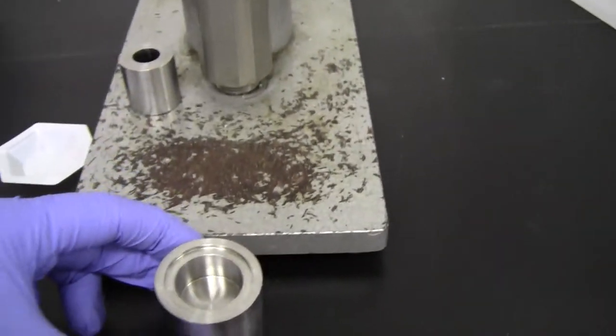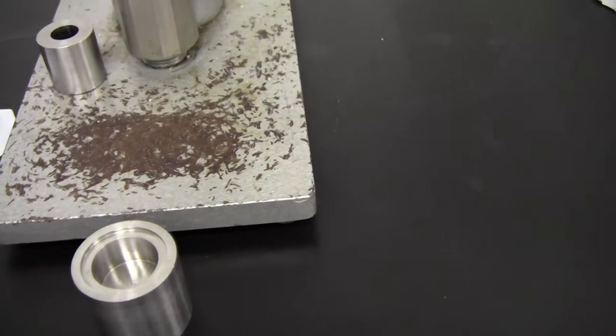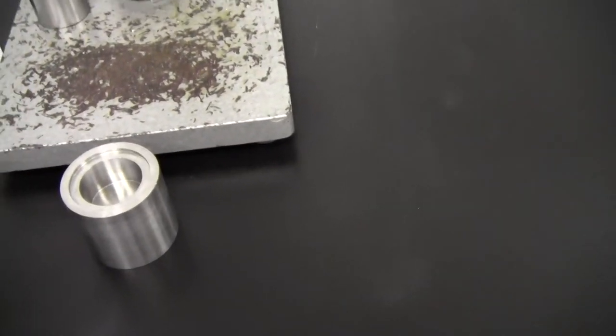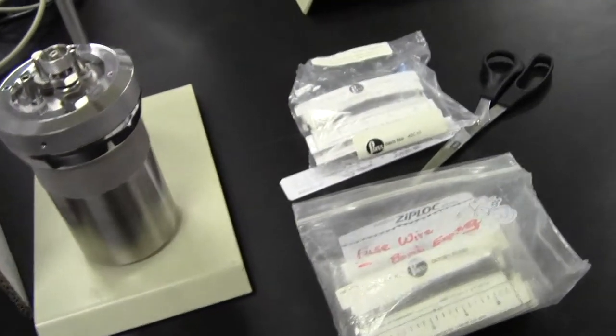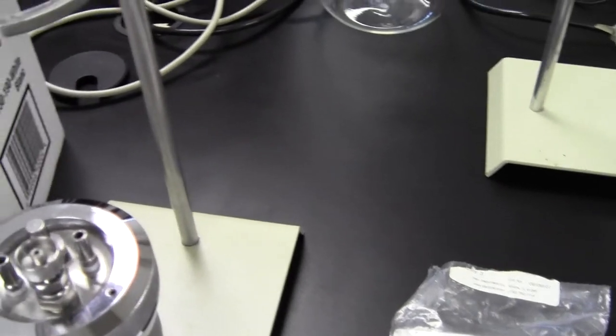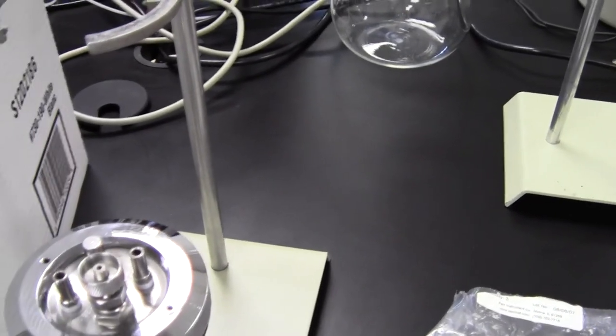And then at that point, you want to take that pellet out and you'll put it into a crucible. And the crucible at the moment is actually inside here. So I'm just going to pause that and come back.